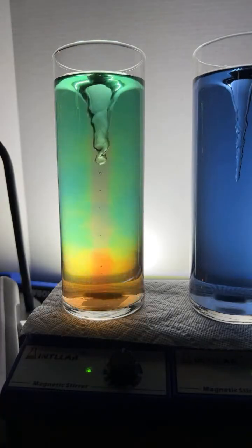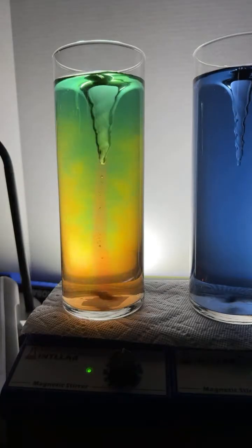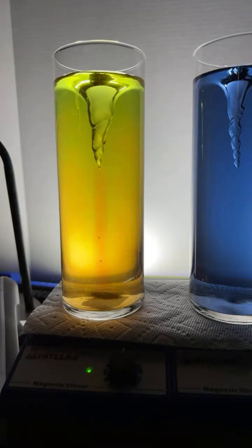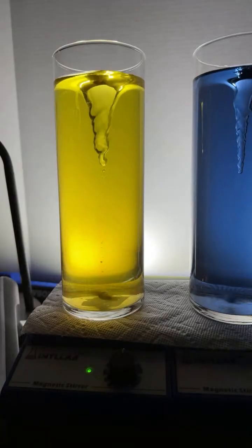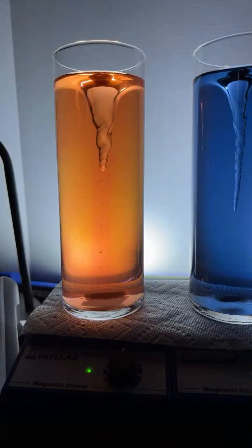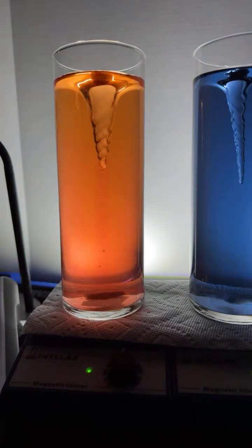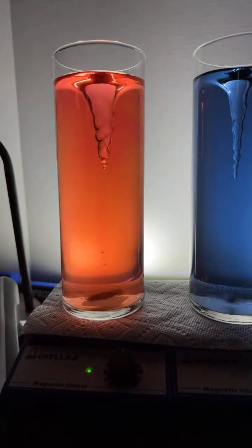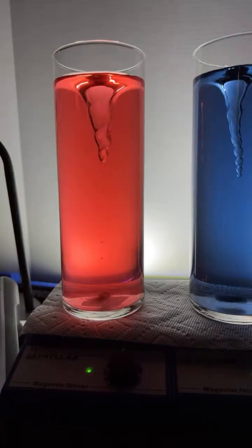So we are probably past the end point now. The end point's when it's green. Here comes number 10, and it goes. Boom. Number 10. Looks like it took us 10 drops to get us to orange. And I'm guessing 11 drops to get us to, there's 11 drops. That might get us to red. The color changes are very, very pretty.